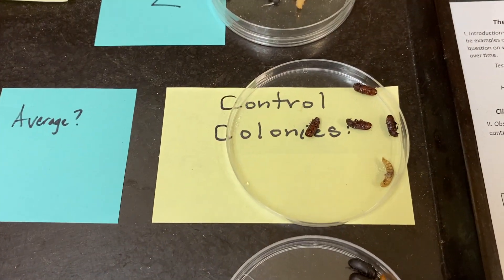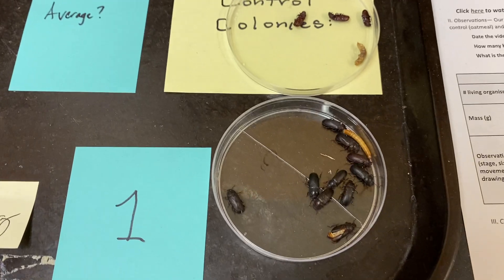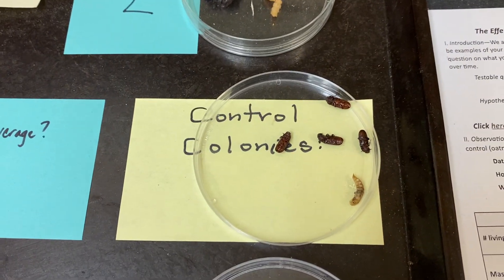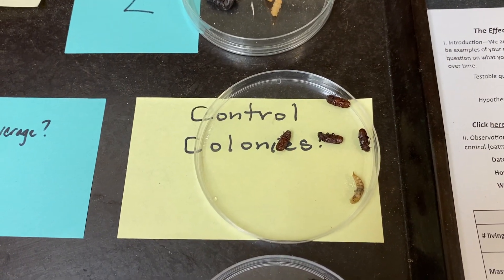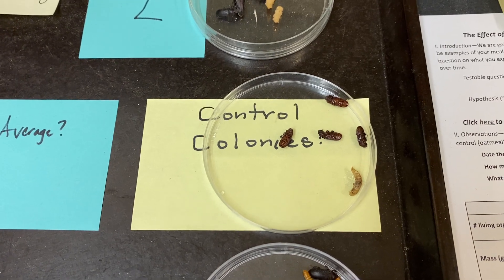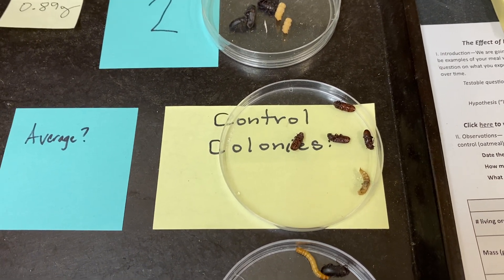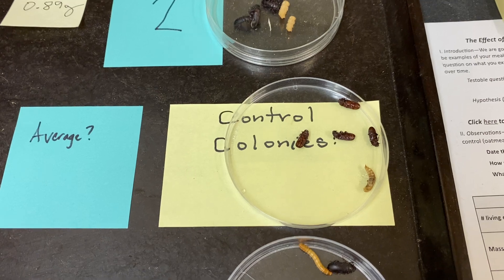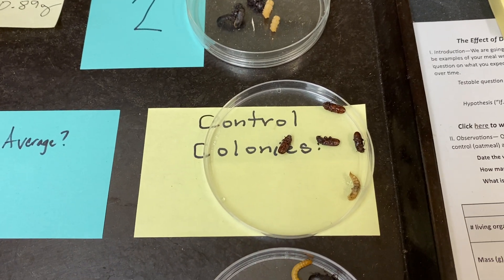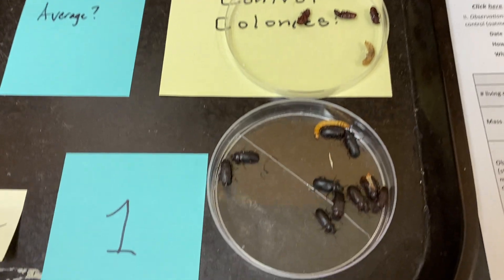First off, you can see basically in the center we have the petri dish for number one and for number two. All we did on this one was grab some of the dead organisms just to compare the numbers of survivorship. You don't need to write these numbers down — just something to notice. So we're talking about the control colonies.